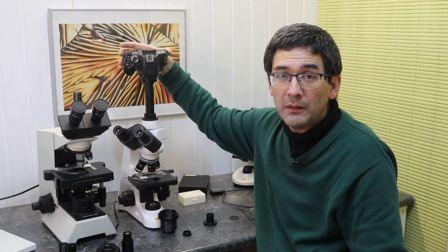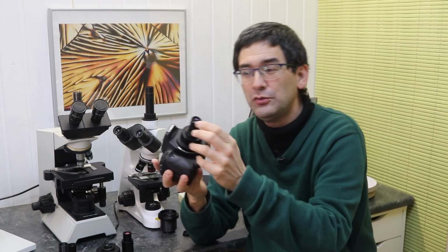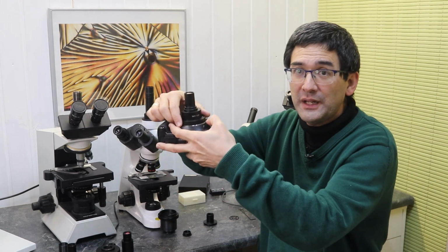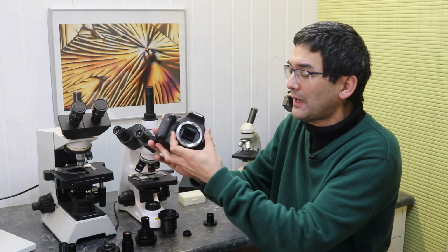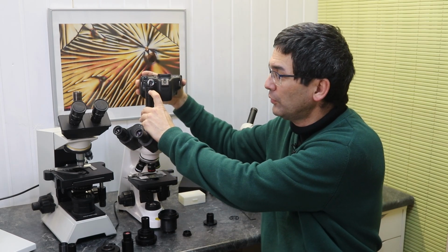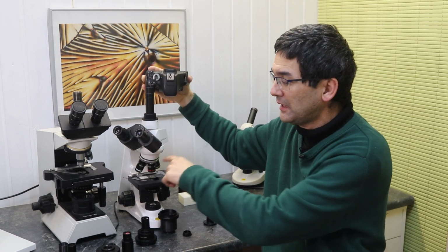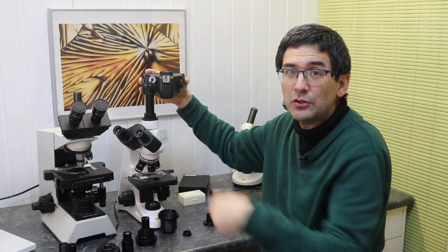That's the theory. What's the problem with that system? The problem is, of course, it's kind of large. And the second problem is that because I'm introducing optics here, I'm actually reducing the image quality because it introduces chromatic aberrations and maybe spherical aberrations, and the image quality is not quite as sharp. So the solution would be, why even have an optic? Why not somehow connect the camera without an optical adapter? Why not connect the camera in such a way that the sensor is located there where the image is projected? So I have to kind of move the camera all the way down. That would be a cool solution, because then the objectives would directly project the image on the camera sensor without any need of any intermediate optics.